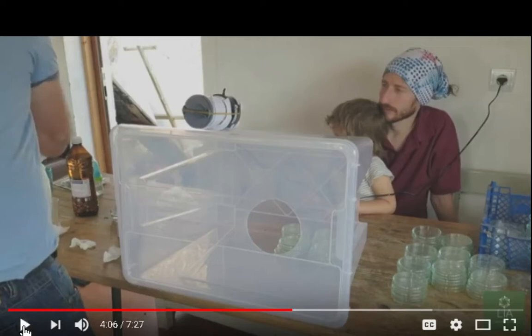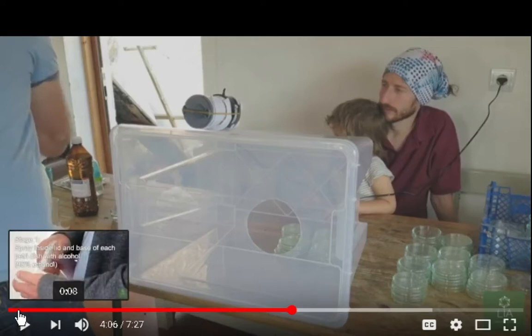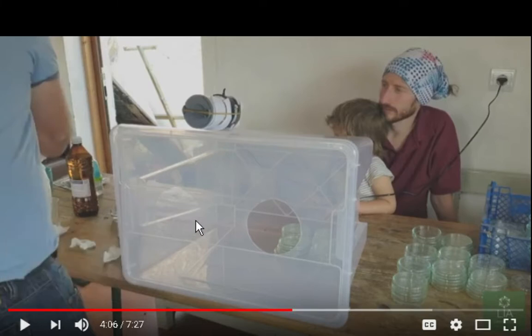Now this is another thing that I don't like. I don't like the idea of just spraying all kinds of alcohol all over the place. It's just smelly, and God, what if somebody lights a match? This is plastic. Everything is gonna go up in flames, and that's one thing that kind of bothers me, the smell and everything. And I'm thinking, I've got my setup next to a window. I was thinking about putting some kind of ventilation and running it outside the window.